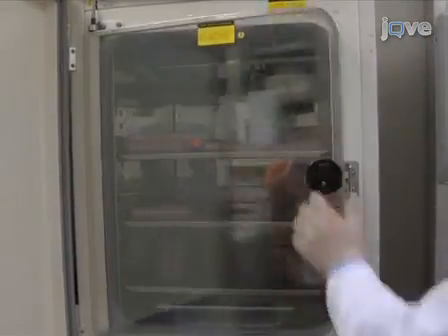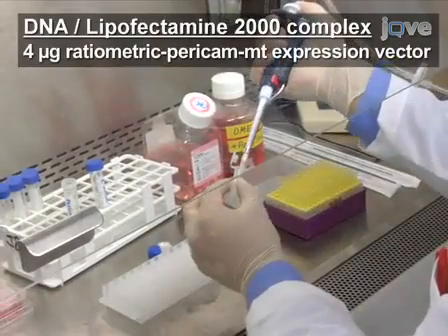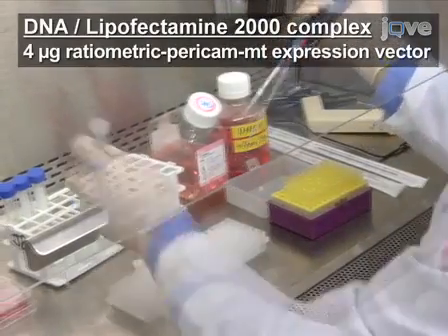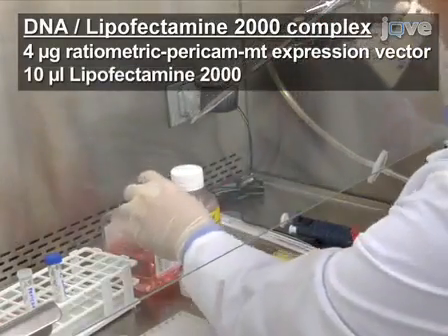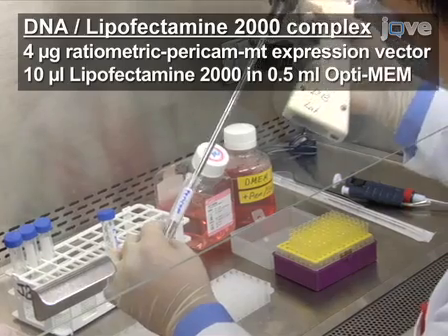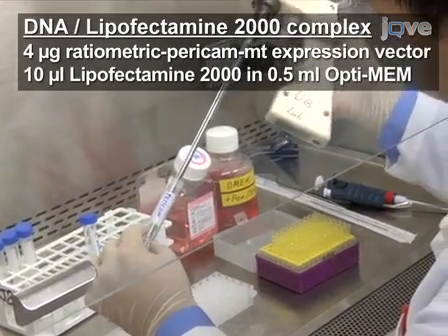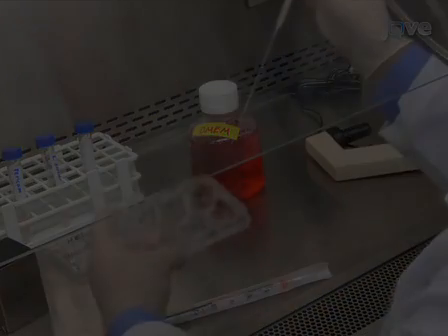The next day, prepare DNA lipofectamine 2000 complexes per the manufacturer's instructions with 4 micrograms of ratiometric pericam mitochondrial expression vector and 10 microliters of lipofectamine 2000 diluted in 0.5 milliliters of Optimem for each well to be transfected. Next, replace the DMEM FBS HeLa culture media in each well.